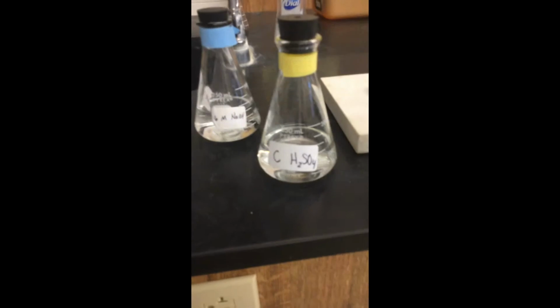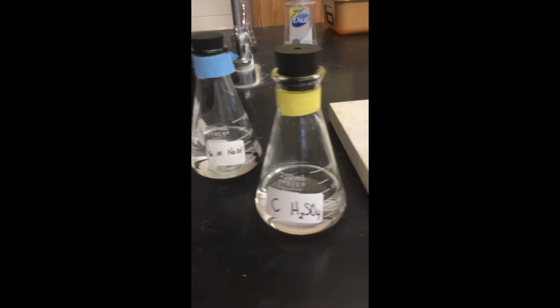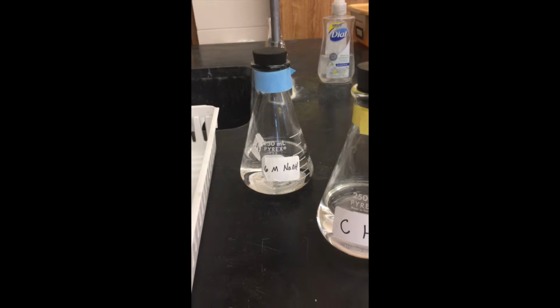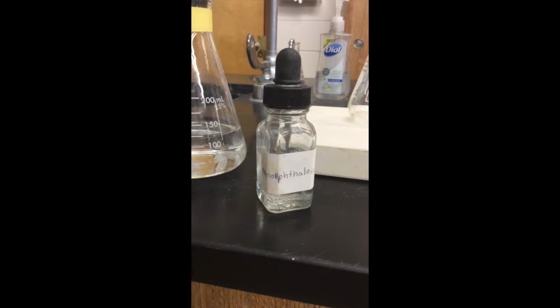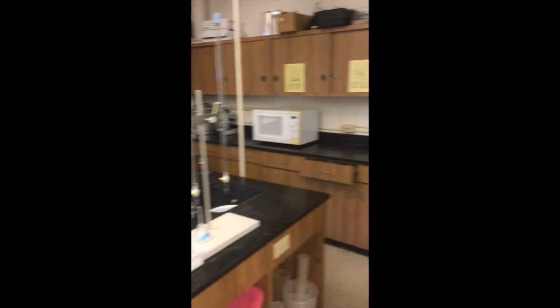to protect hands. For each titration, there were 3 specific acids, 2 different concentrations of HCl and 1 concentration of sulfuric acid, each time mixed with a 0.196 concentration of the base NaOH. Phenolphthalein was used as the indicator to show the titration. The 2 burettes were set up for the acid and the base.